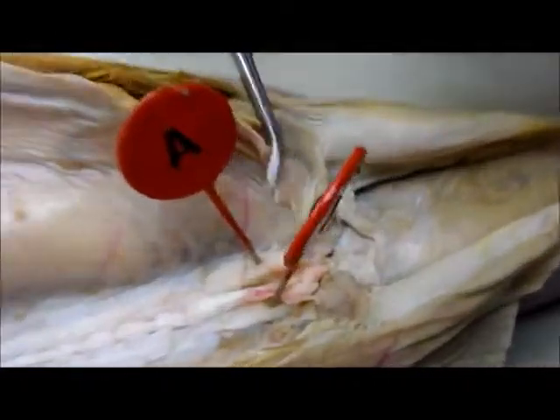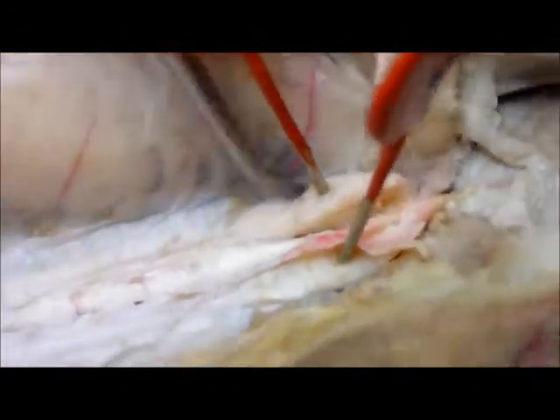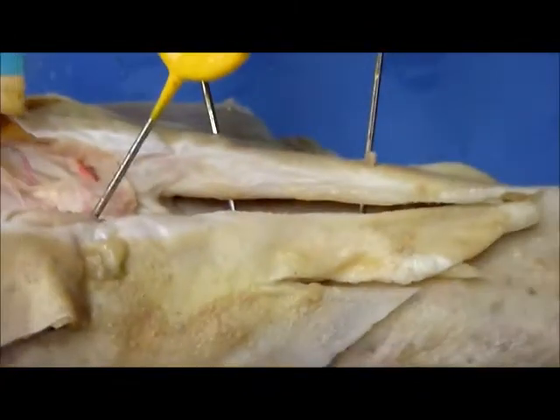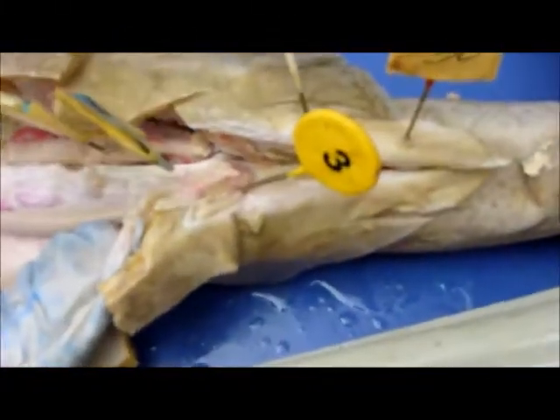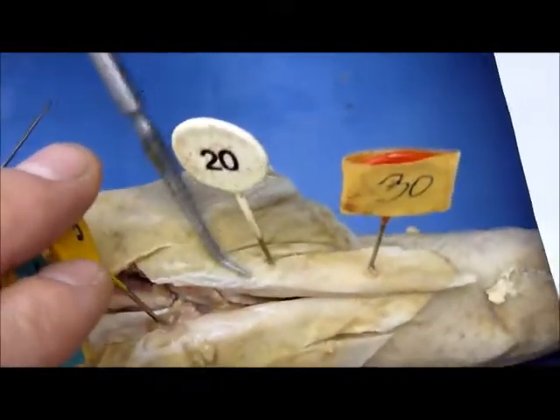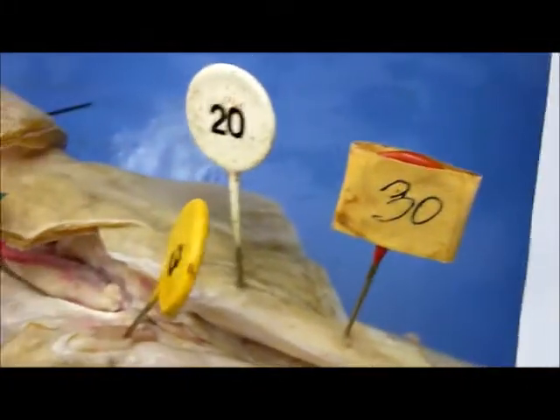J and A of the sperm sacs — move them out a little bit so we can see them. J and A, and those are in the bottom. Number 30 is our claspers; these are only on the males. Number three is the cloaca — that's the opening. Number 20 is the siphon, it's on top of the claspers.